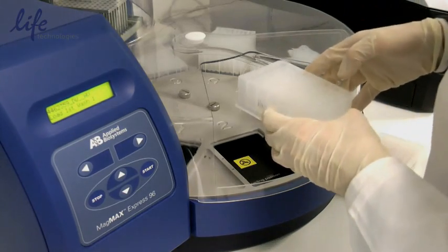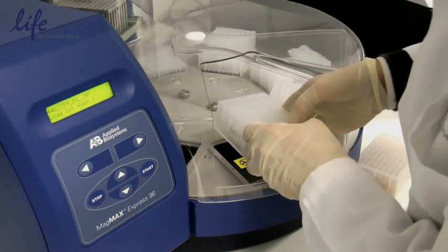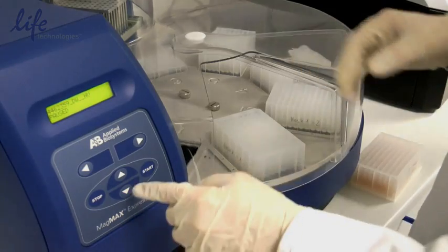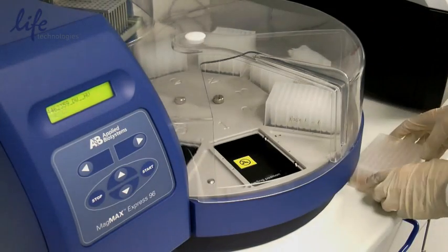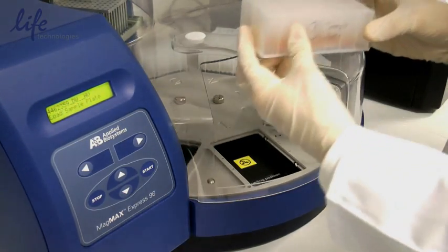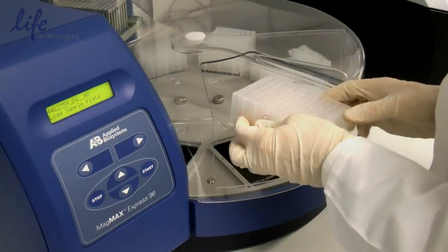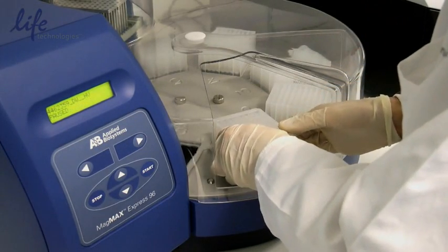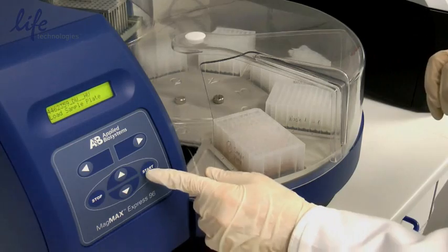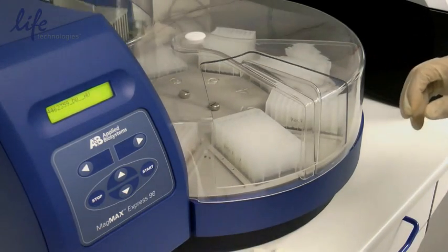Then first wash 1. And finally our sample plate. Then as we click again on start, the script will launch.